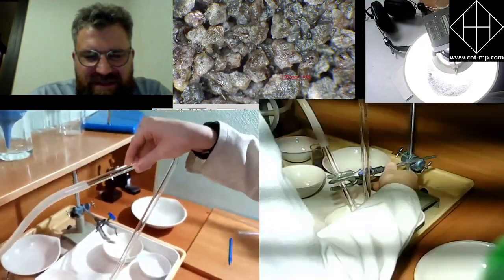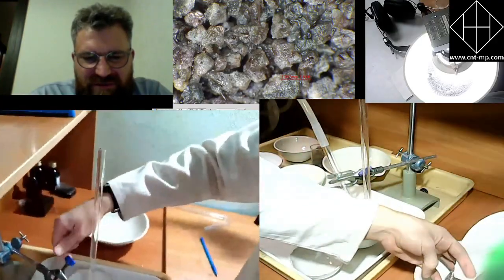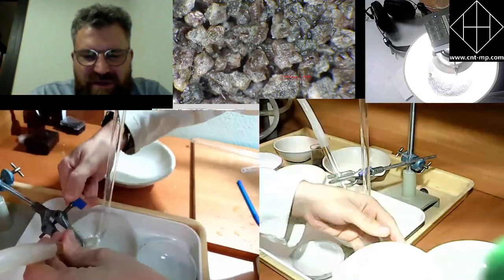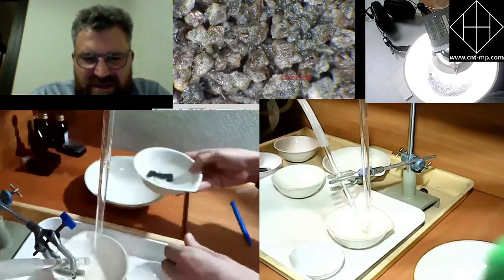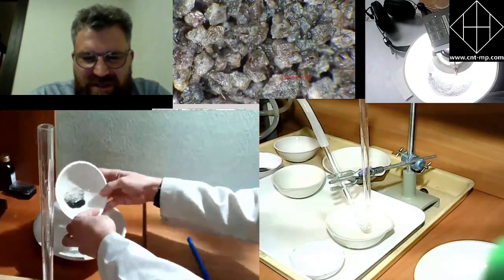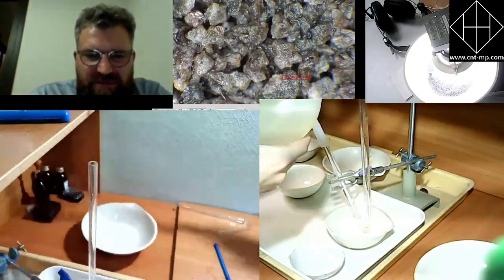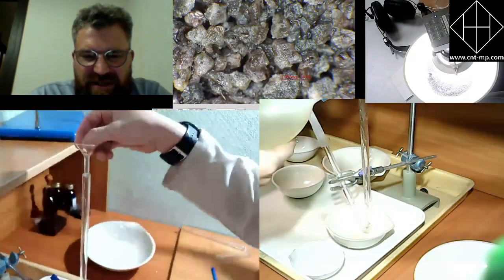But yet again, I just want to say we have enough to get to the final concentrate. It takes a little bit more time, and this time we don't have that amount of time here at this stage of training. But at least we're going to be showing you the final product of hydroseparation. It's definitely important to preserve all the sulfide grains in it.